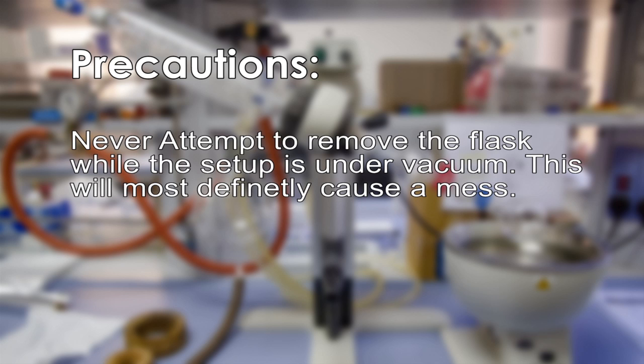Never attempt to remove the flask while the setup is under vacuum. This will most definitely cause a mess.